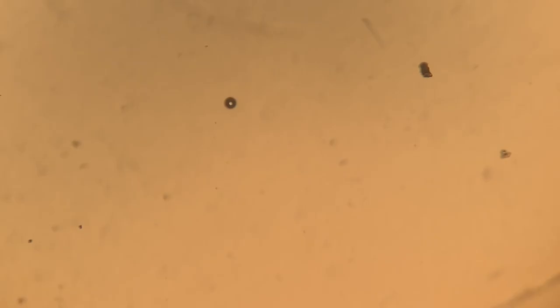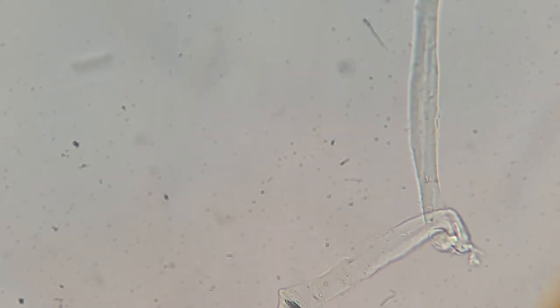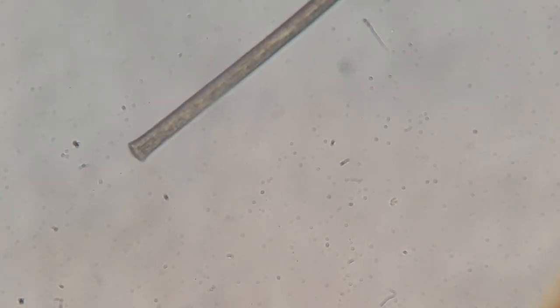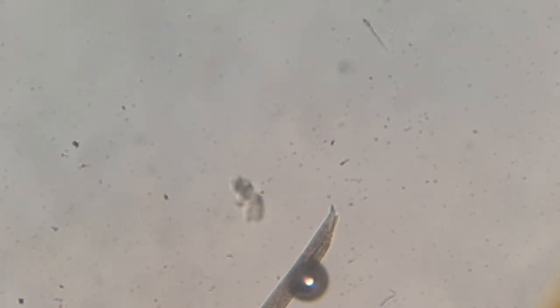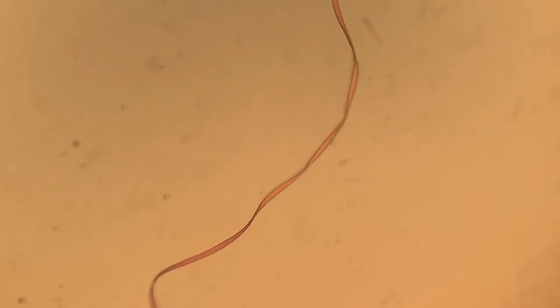So let's go ahead and look at the agave. Now with the agave, it kind of took me a while to get my bearings, mainly because there wasn't too much stuff in here. I was looking at these cracks in the coverslip and some air bubbles and kind of zooming around. But eventually I started seeing little strands like this, and once I started seeing one or two, eventually that turned into a dozen and then close to over two dozen of these little strands. Now these probably aren't from plants and probably aren't from animals. They are in various lengths and sizes, and they have a continuous look or shading to them all throughout. That kind of leads me to believe that what we are looking at are microplastics. Now, microplastics in agave — that is probably a little bit unsurprising to me, mainly because this came from some factory from somewhere and it is in a plastic container.